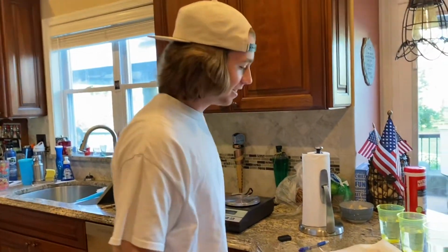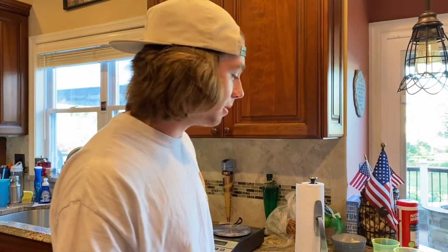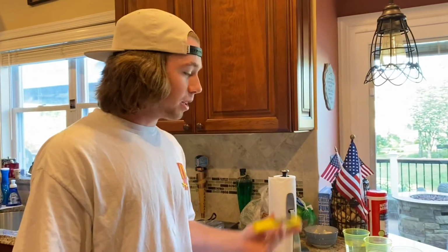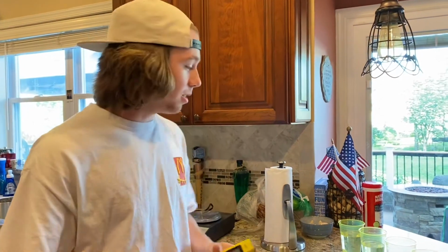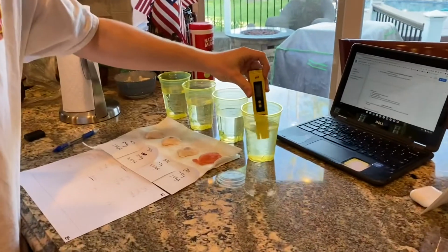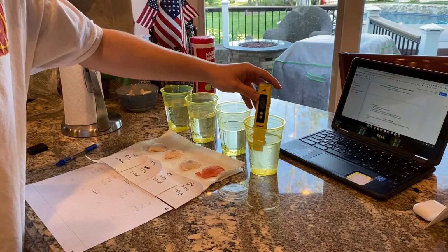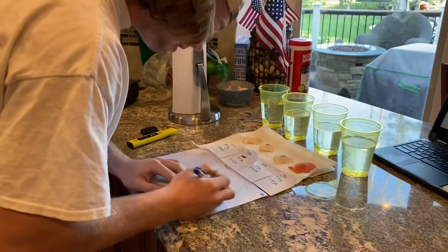All right, welcome back. It's like 5 days since we put the shells in the solutions. And 2 days ago, I took the shells out so they could dry off, so they're not waterlogged. Since they're out and dry, we're going to test the pH of the leftover solutions just to see if that changed at all. So we're going to dip it in, stir it around, wait for it to stabilize. All right. So we got 8.52.